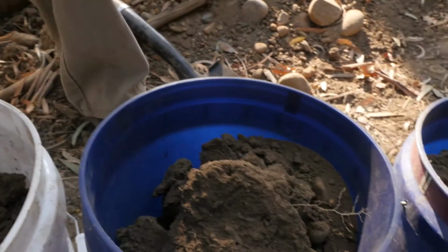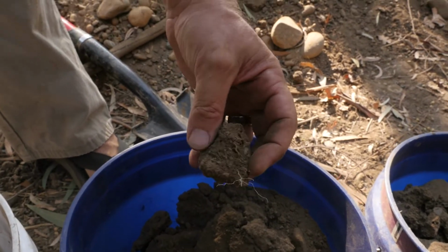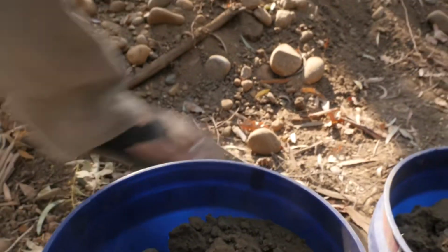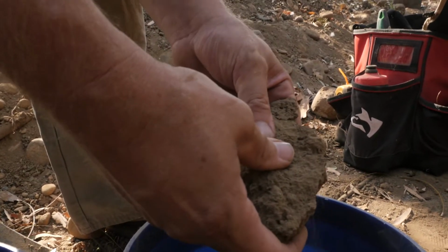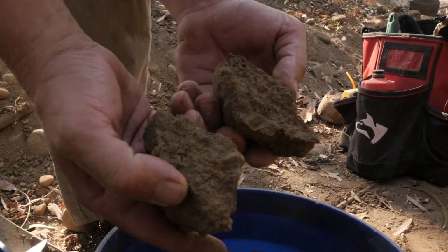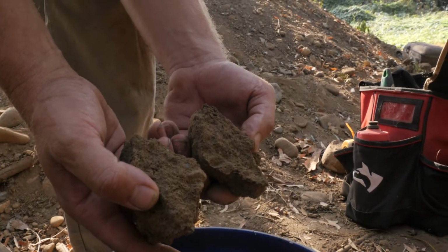Then we drop into this subsoil horizon, right? Zone of accumulation. We still have aggregation, but it's not as consistent, a little bit more rounded, that kind of stuff. But we see biological activity in pores and roots and all that kind of stuff. Then we get down to the very bottom, that C horizon material. You can see the contrast in color between these two. That's more organic matter, this is less. This you can start to see clean mineral grains in the gravels and some of the fine sand, some of the sands. This is less differentiated. And then remember, this would be the material that was first deposited on top of that river channel with those gravels and cobbles.